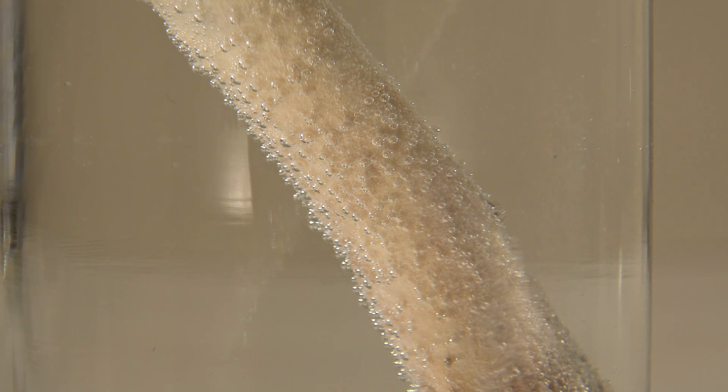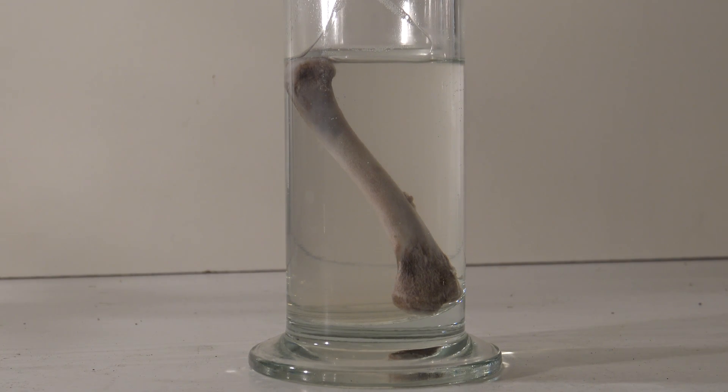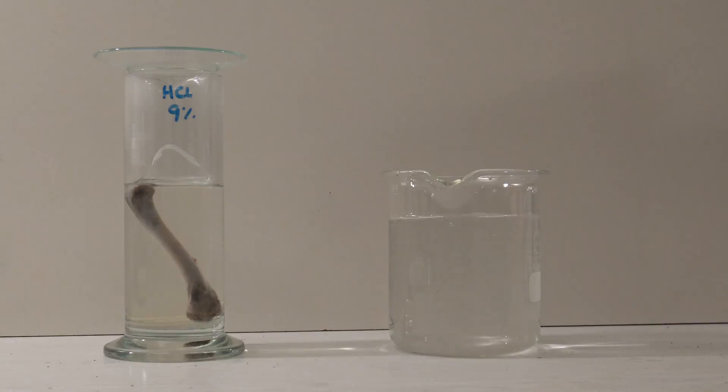Then the setup was left overnight. On the next day the bone had turned a bit darker and the release of gas bubbles was over. A beaker that did fit into the cylinder was found to keep the bone completely in the acid overnight.